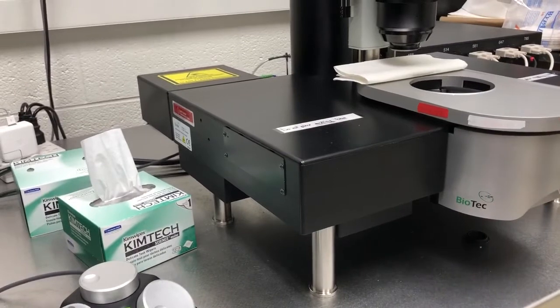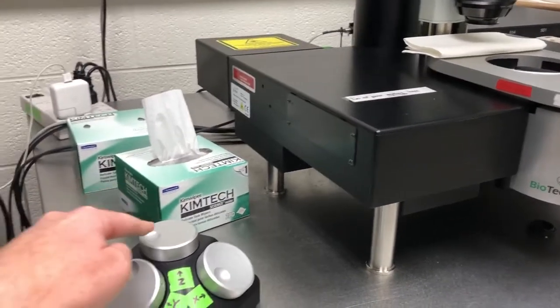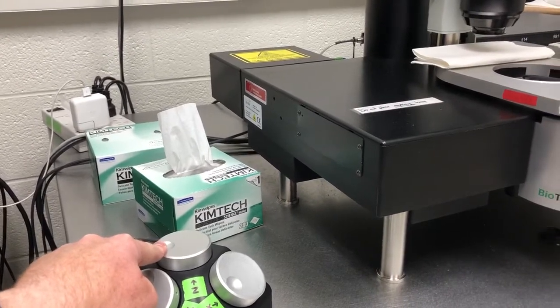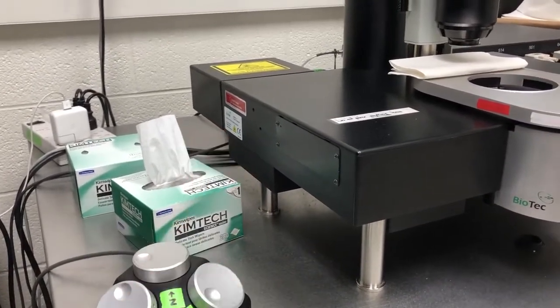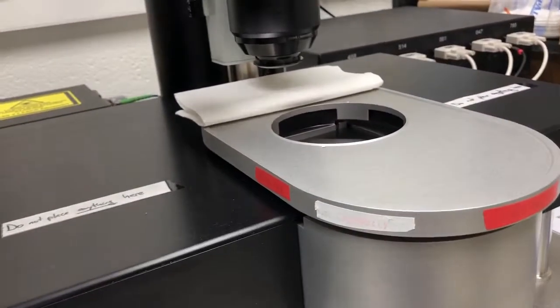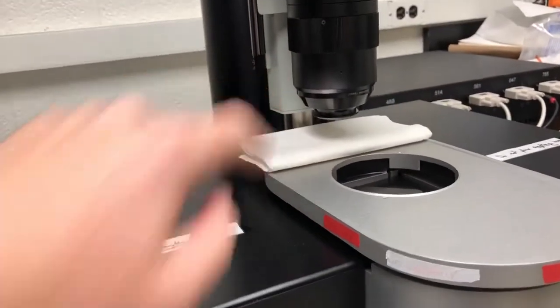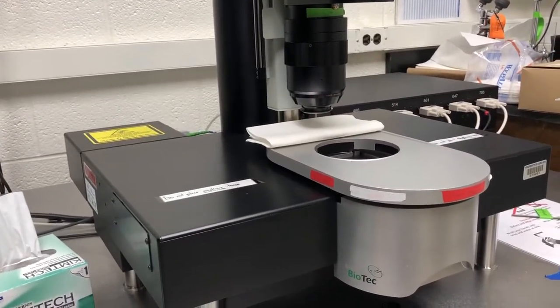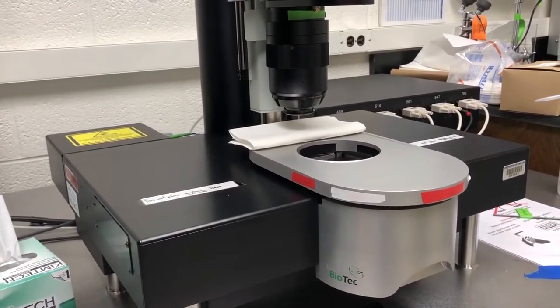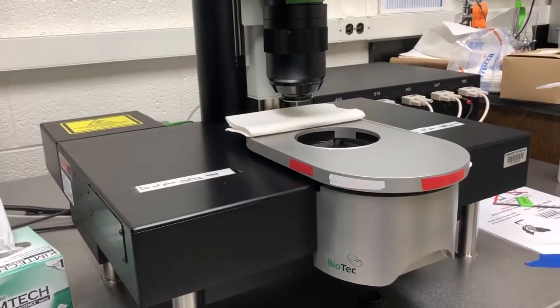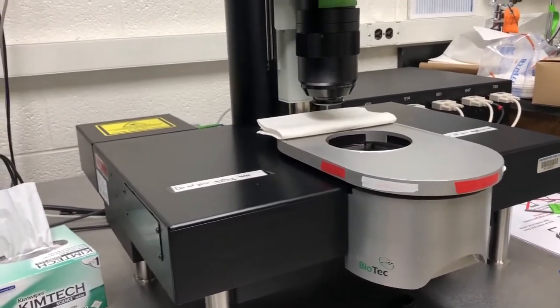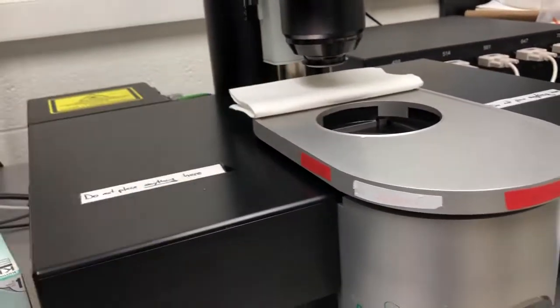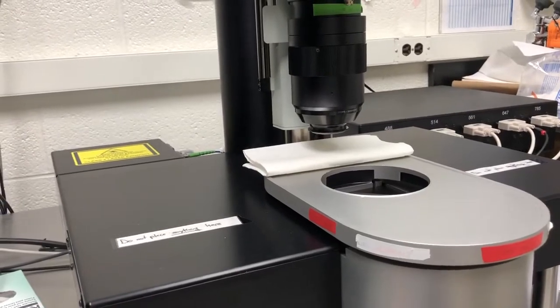But the main thing you have to keep in mind is when you're going up with the Z-drive, which I'll show you in a moment. When you're moving the sample up, be very careful. When you're moving the objective down, also be very careful. There are ways of keeping track of where you are, where the front face of the objective is relative to the sample. Please pay attention to them, because if you don't, you can slam the objective into the sample and crack it, which will damage a piece worth hundreds of dollars that needs to be replaced.